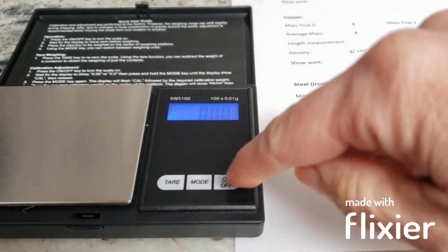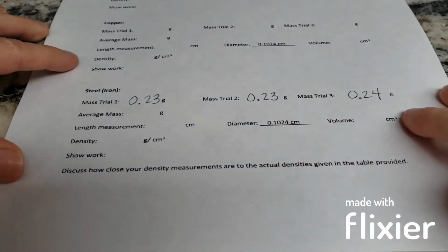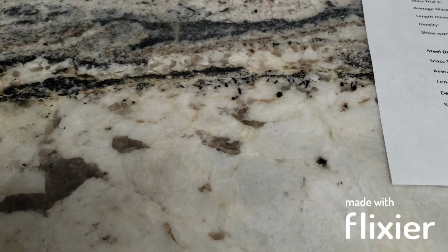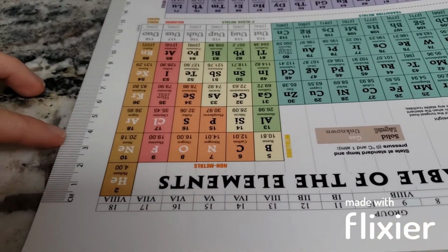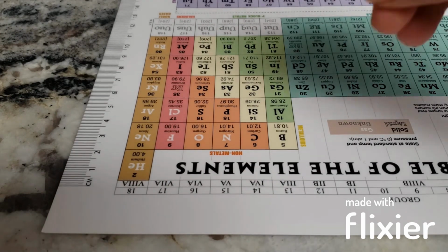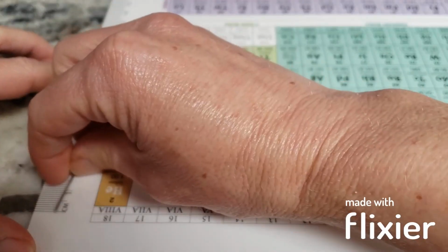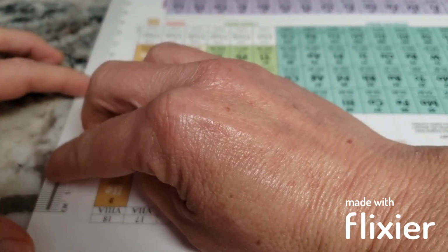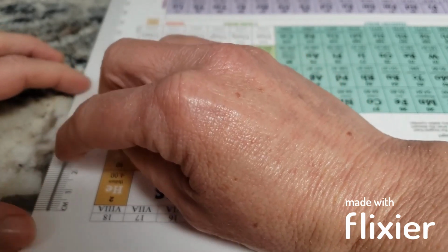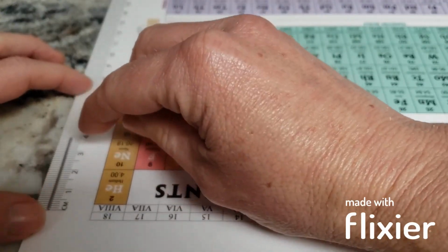All right, we're going to finish up the experimental work before we do any of the calculations. So I have all 3 of my mass trials written down here. And the next thing I need to do is measure the length in centimeters. So even though it said it's 2 inches, that's approximate. So I'm going to take this ruler, or you can use any ruler, but measure it in centimeters. And remember, your ruler is marked to the tenths, so you need to read it out to the hundredths. So I'm going to try to get it straight on here.